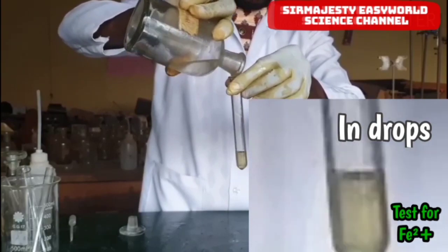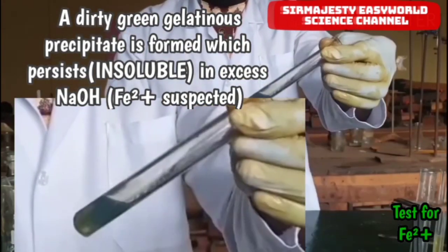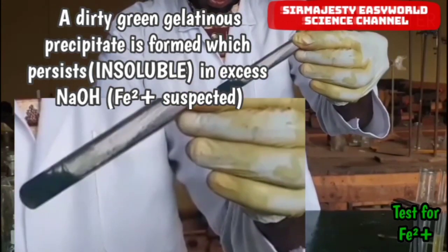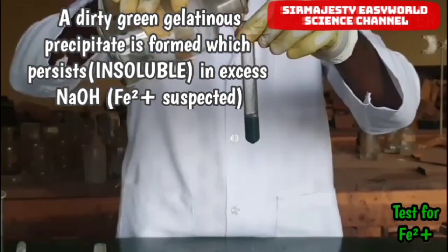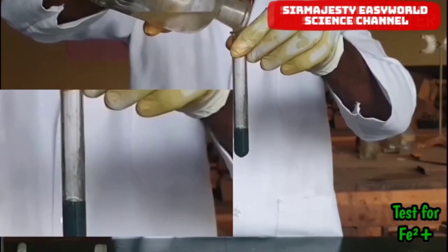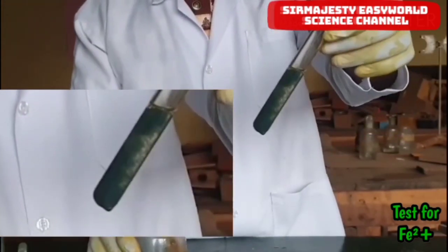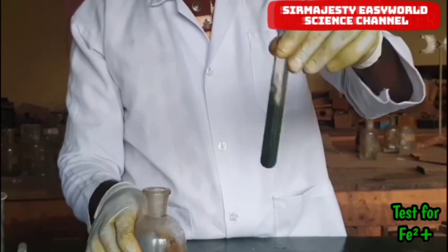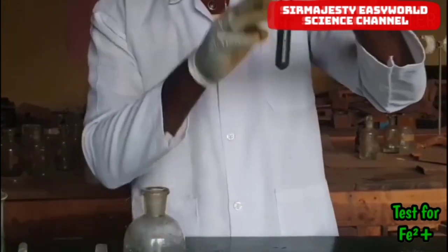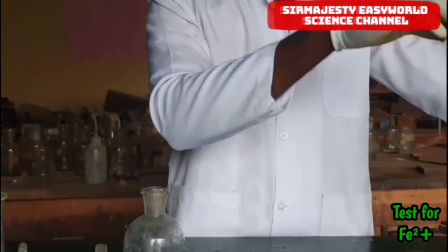With aqueous sodium hydroxide, a dirty green gelatinous precipitate is formed. This precipitate remains insoluble when we add excess aqueous sodium hydroxide. Then, on exposure to atmosphere, the dirty green gelatinous precipitate turns reddish-brown due to atmospheric oxidation of iron 2 to iron 3 by oxygen.